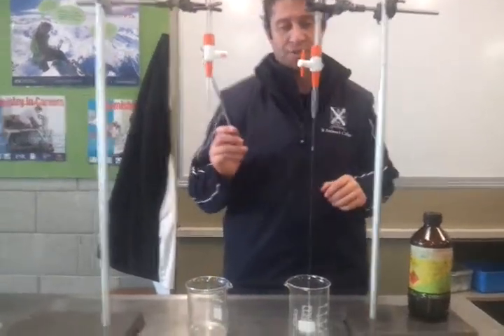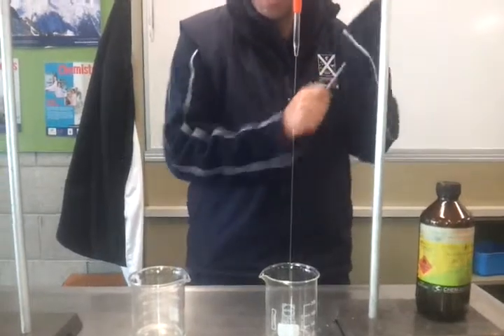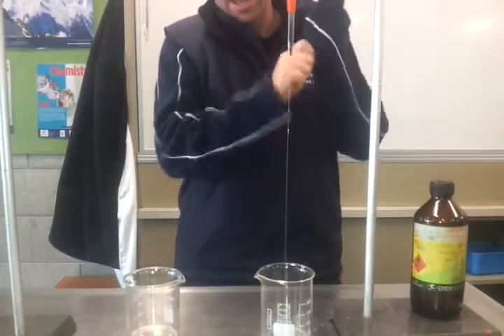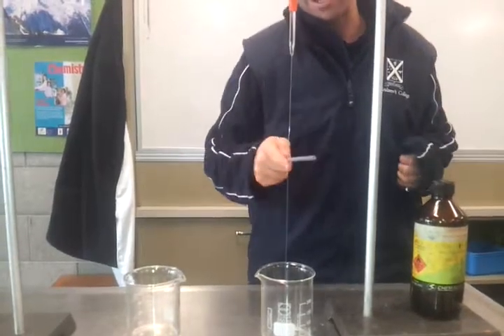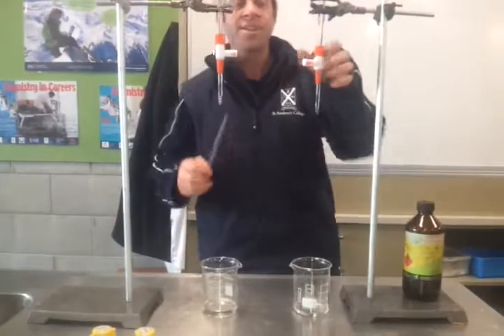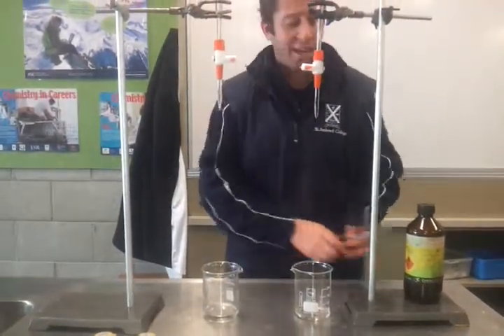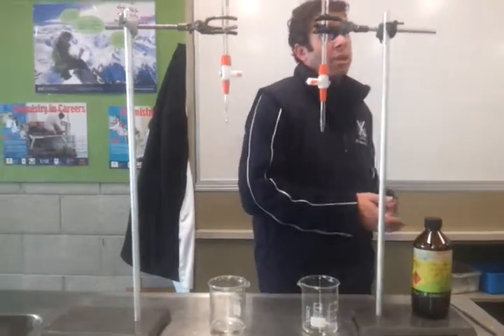There it's running just straight through, and I've put the charged rod near it. Maybe I haven't charged it enough, so let's give it a bit more charge. It's rather hot, so I can be pretty confident that it's pretty well charged, and I'm getting absolutely nothing from it. So that's a physical observation that we can make to just get that idea: is it a polar liquid or is it a non-polar liquid? Or solvent is probably the word I should use.